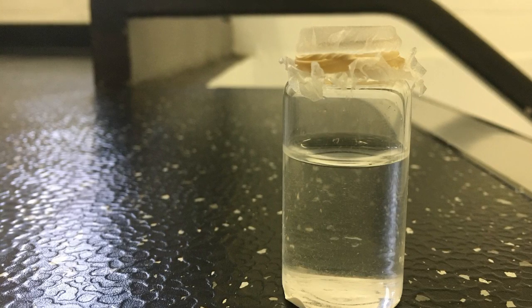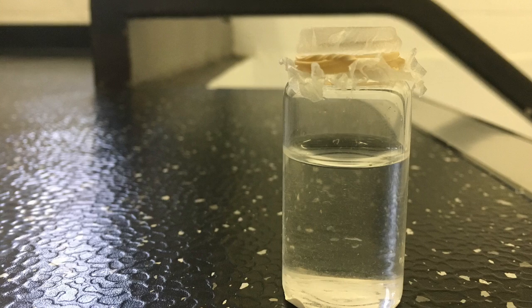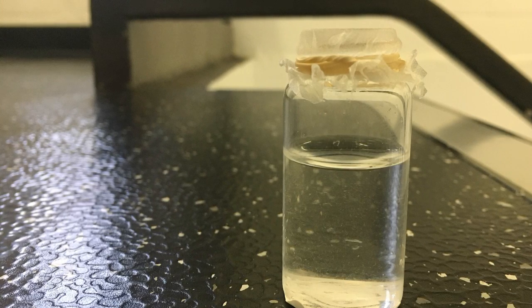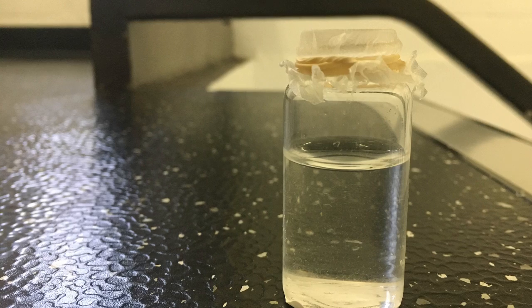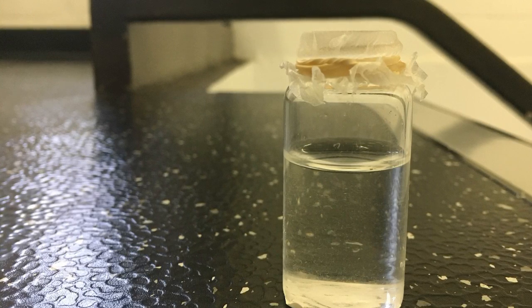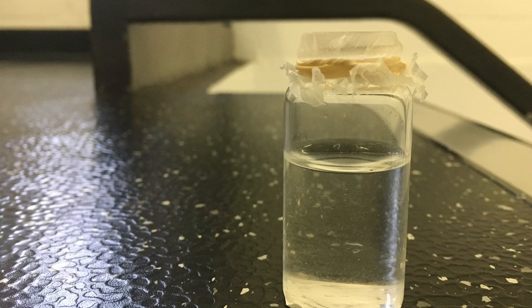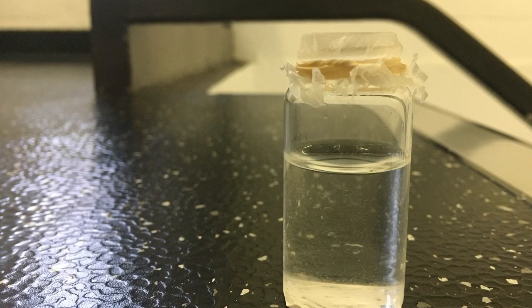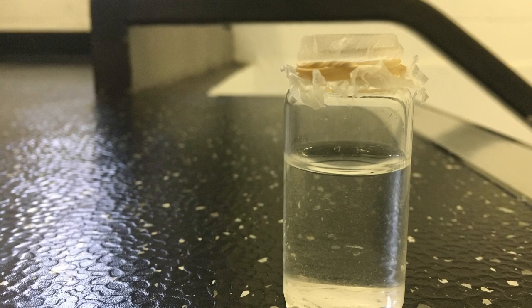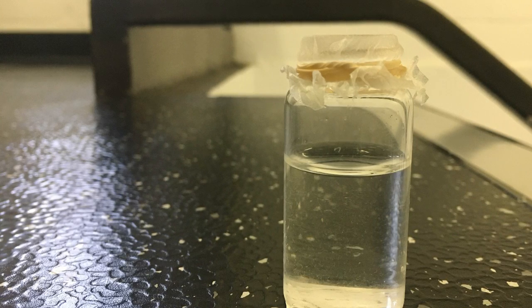The first step is to obtain 1 gram of aluminum foil, a 400 milliliter beaker, and 50 milliliters of 4M KOH. Within our lab group, our mass of foil was 1.0588 grams. The next thing you must do is pour the 50 milliliters of 4M KOH into the 400 milliliter beaker and place the aluminum foil into the solution.